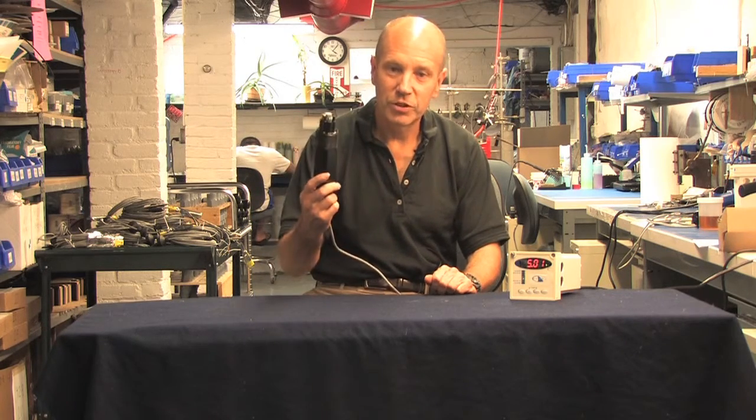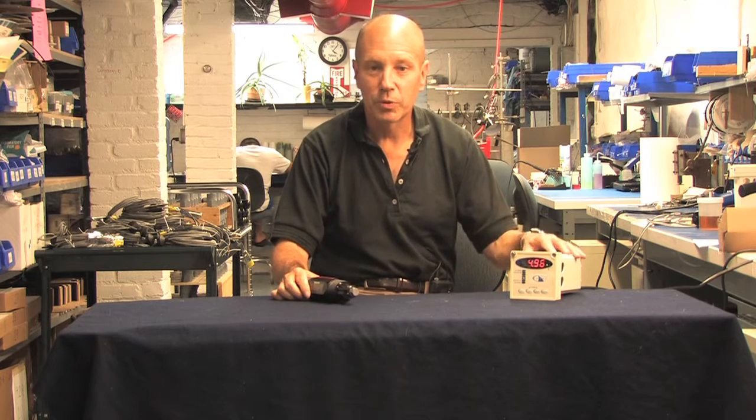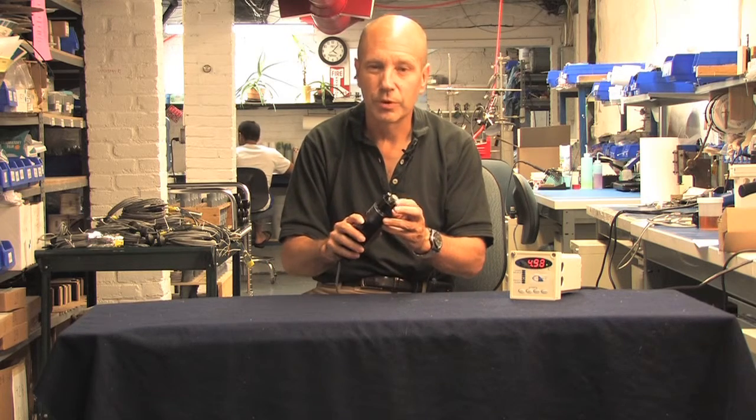I'll be using our signature P60C8 probe and the Shark 120. First, let's answer the basic question, how do I know when to change the reference solution and the salt bridge? In a typical setup, you would change the reference solution about every 3 months and the salt bridge every 6 months. You would also clean off the process electrode with every reference solution change. But no installation is truly typical, and you might find yourself doing maintenance on the probe every week or once a year. Fortunately, it's easy to tell when your probe needs a little TLC.